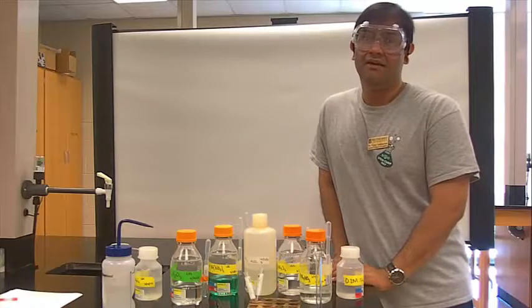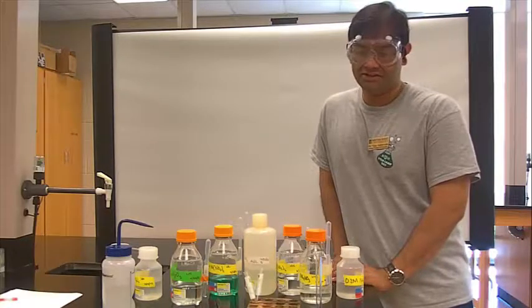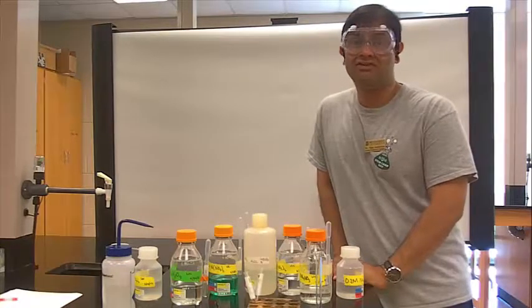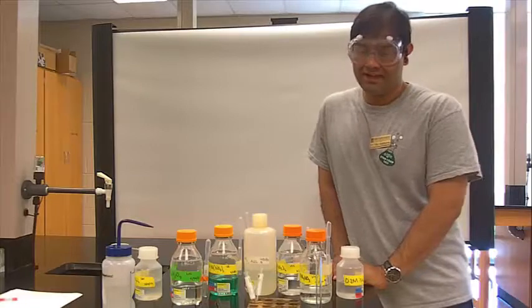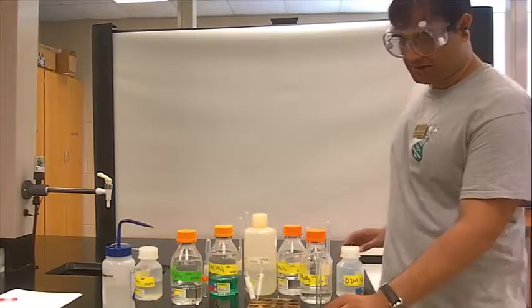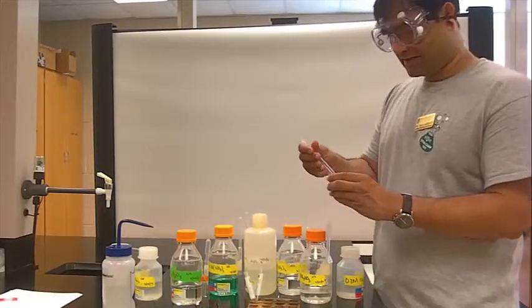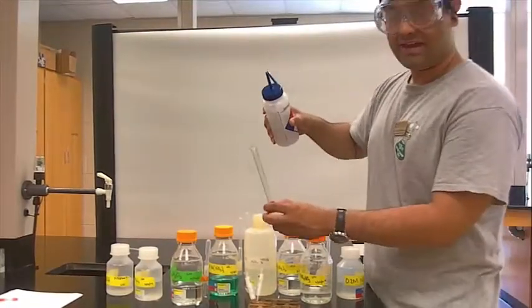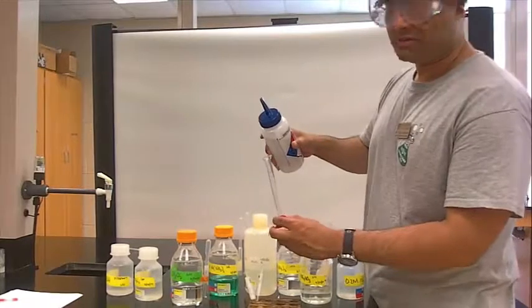Products could form a precipitate, or they may stay in solution. For this particular experiment, you're going to want to have your solubility table handy. The first thing that you want to do is estimate one mil. Take a 10 mil graduated cylinder.